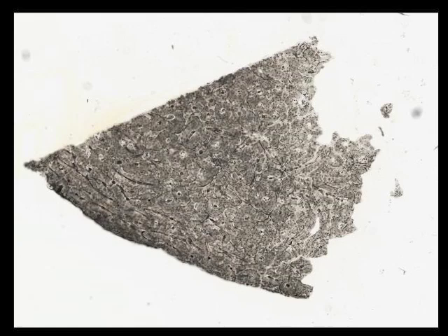This is a very easy slide to understand and to interpret. This is a slide of ground bone. Ground bone is not prepared in the traditional way of sectioning the tissue, but because it's so calcified, this is actually a sliver of bone which has been ground on a grinding wheel until it's thin enough to be transparent. And so this section has no stain on it. And the contrast which you see is just based on the thickness and constituents of the bony material itself.